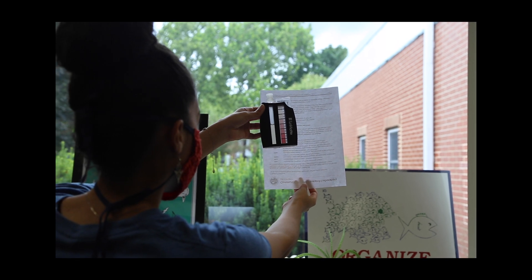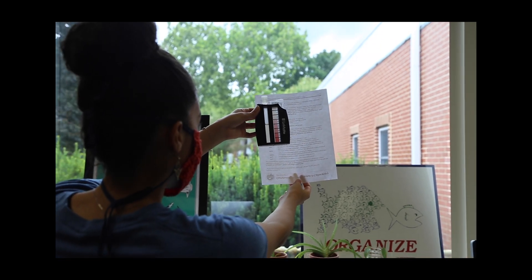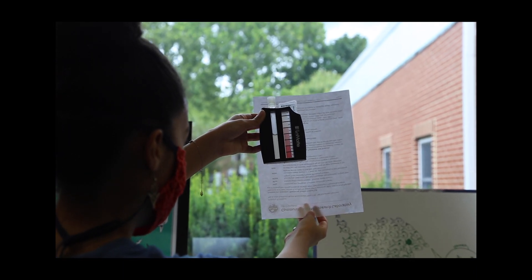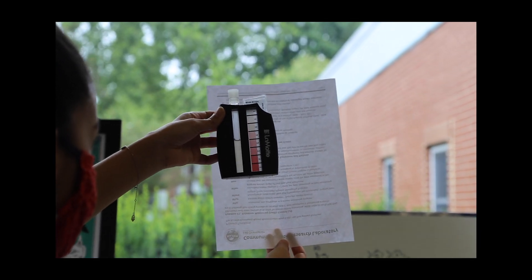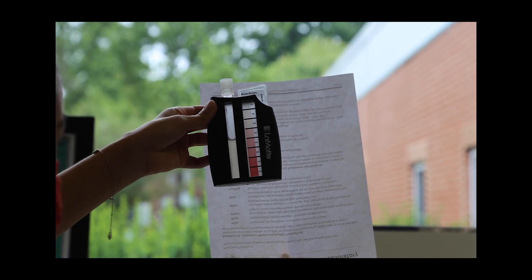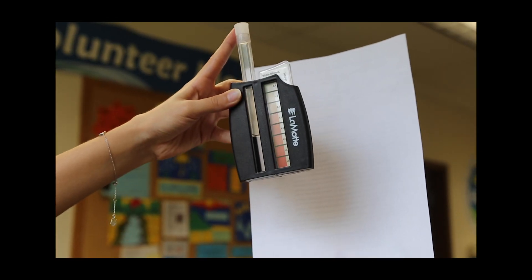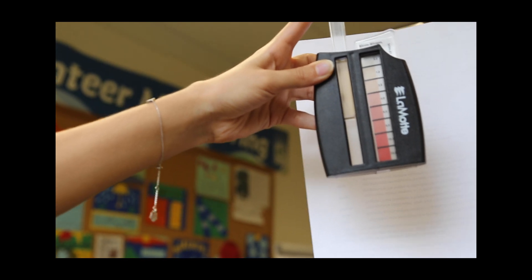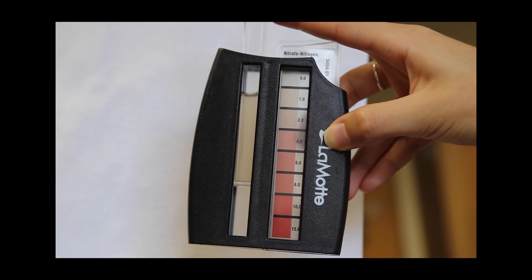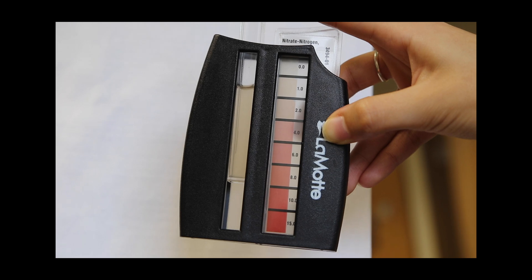If you are having difficulty determining what color matches your sample best, it is helpful to ask another person what color they are seeing by having each person write down their value and then discussing. Also, the colors are on a saturation scale, so actively think about how concentrated the sample looks with the light pink reagent.